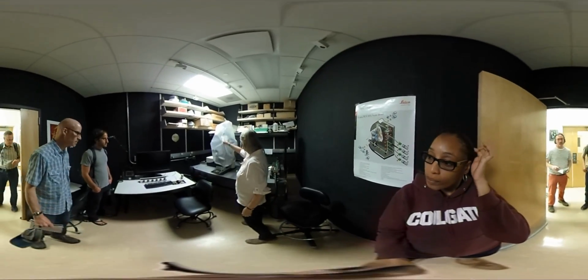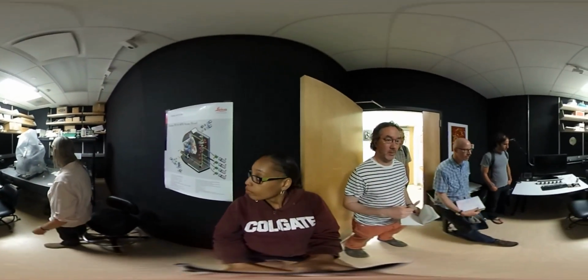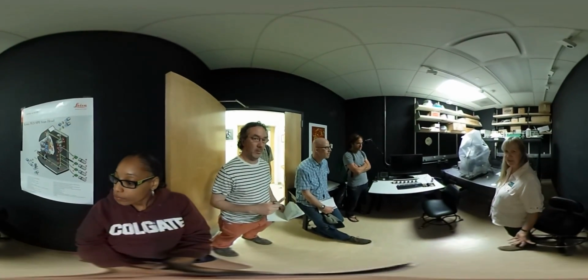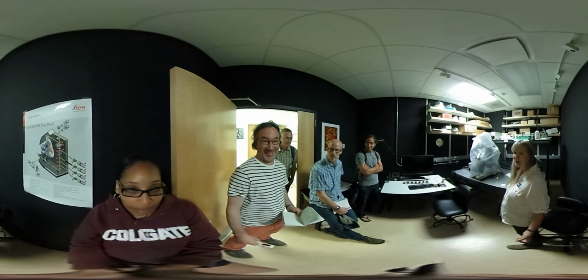A regular microscope that you might... it might look familiar to you, but it's really jacked up. It's really super cool. We use lasers. A lot of microscopy is laser based now. So what kind of microscope is this? This is called a multiphoton confocal microscope. Wow, multiphoton, cool.